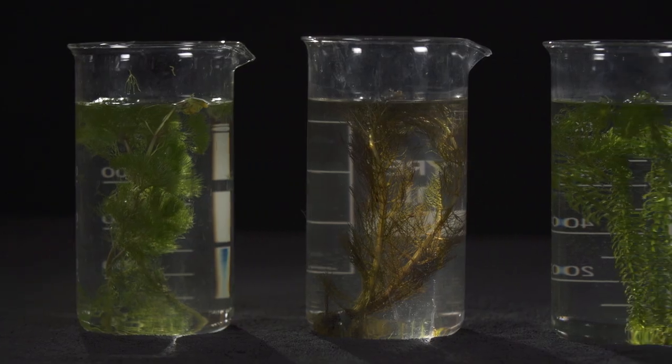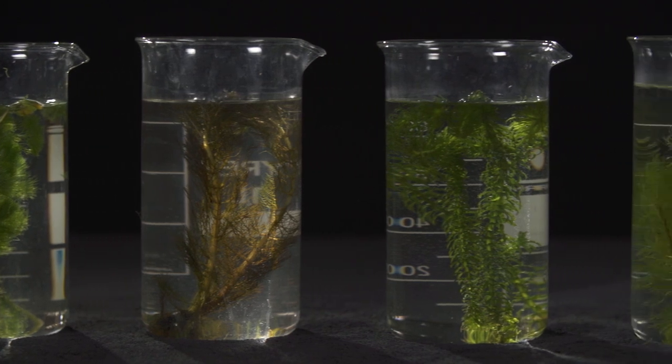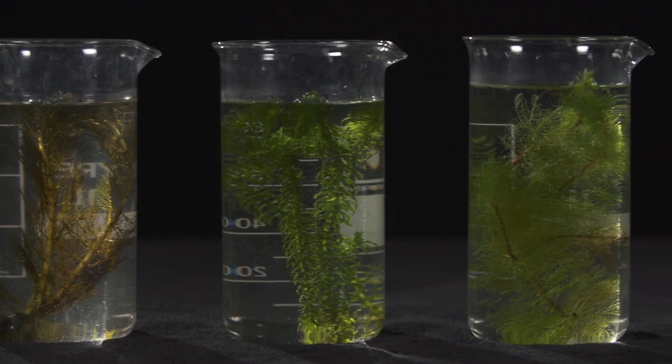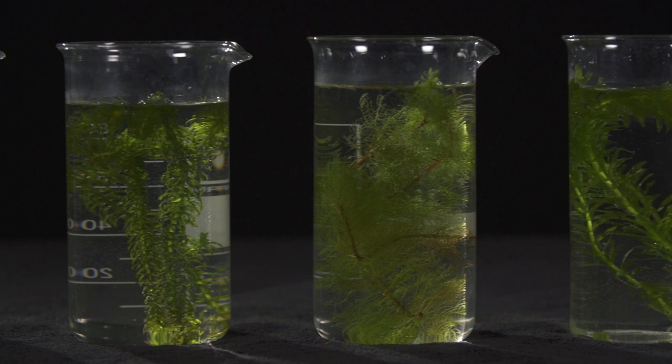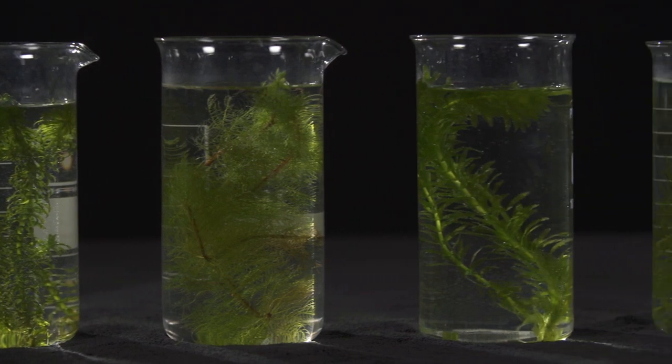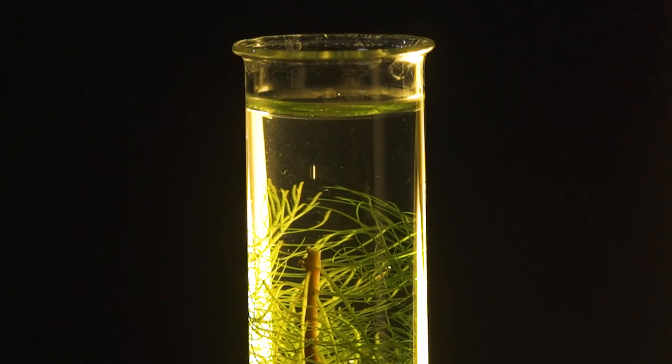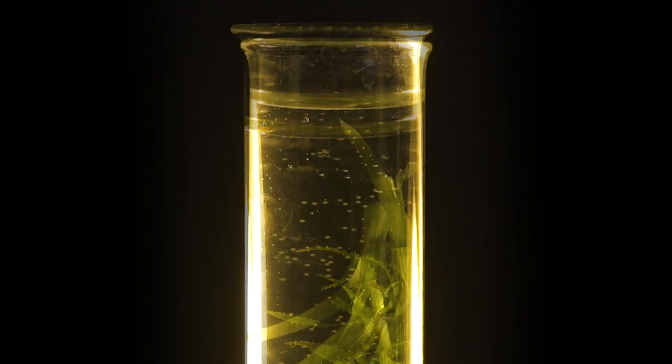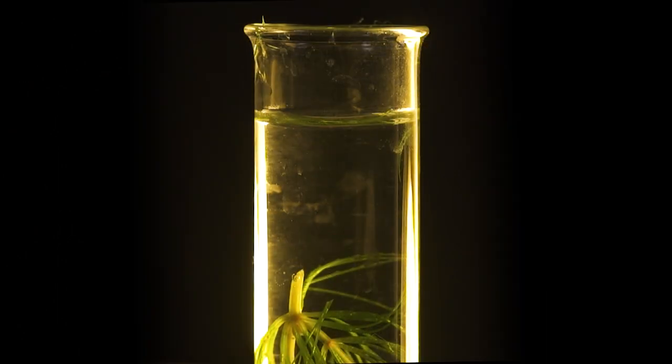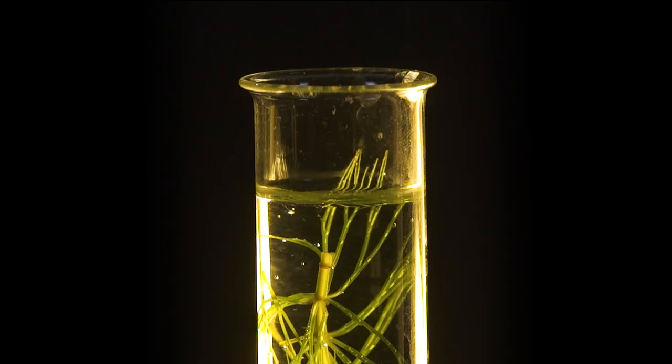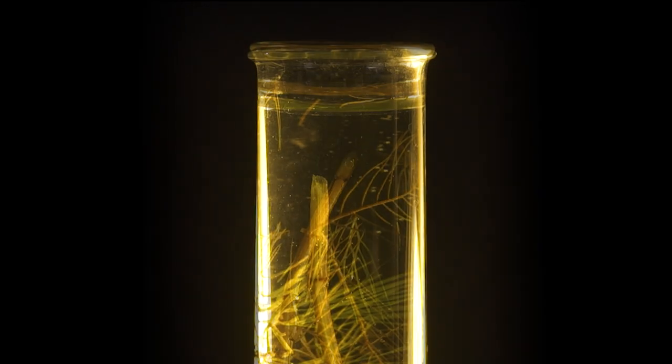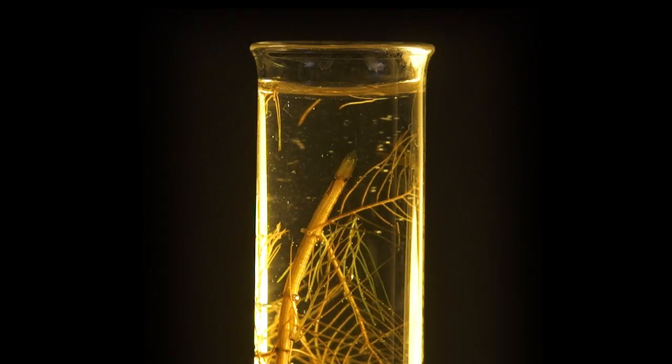There are loads of pondweeds available that you can use for this practical. Previously, Cabomba caroliniana was suggested, but it's now unavailable. To help you prepare for this activity, we have a range of pondweeds here, all of which you can see are producing bubbles. Today, we're using the following species.